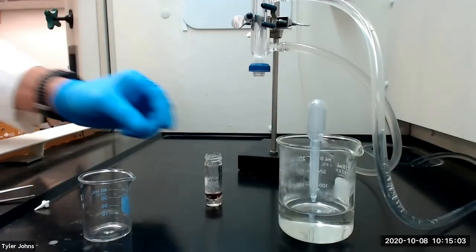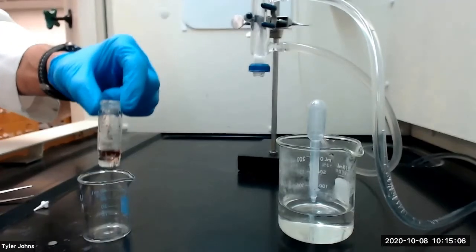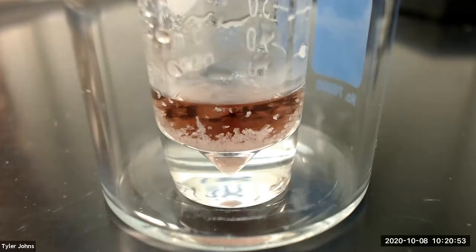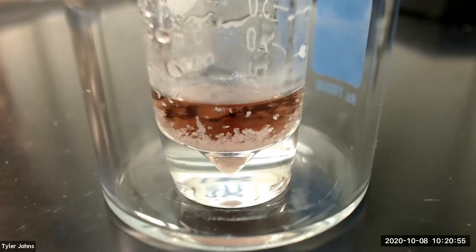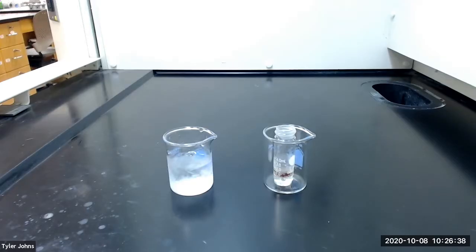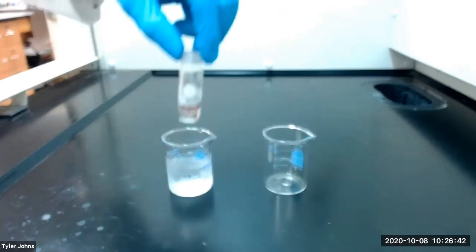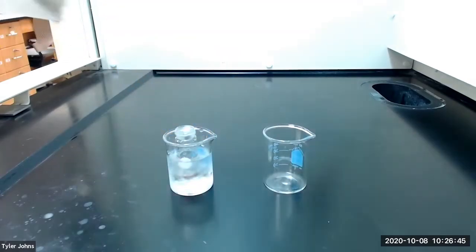We'll rinse the spin vane with several drops of warm deionized water back into the conical vial. We'll then place our conical vial in a 50 milliliter beaker and allow it to cool to room temperature. Once cooled, we will place the vial for about 10 minutes in an ice water bath to complete crystallization.